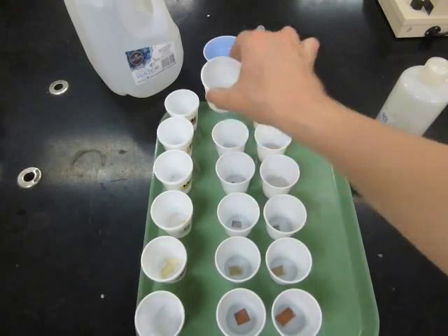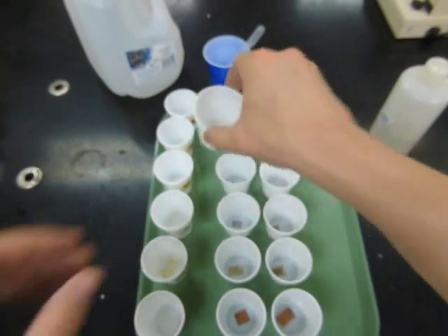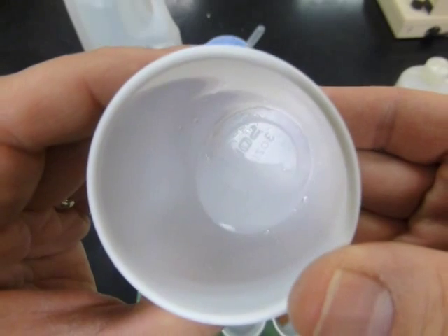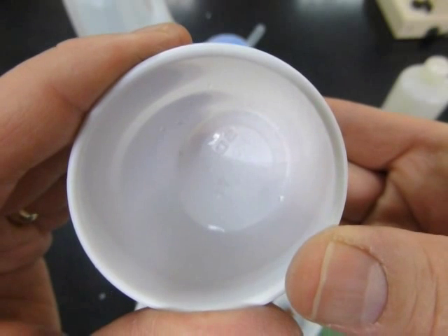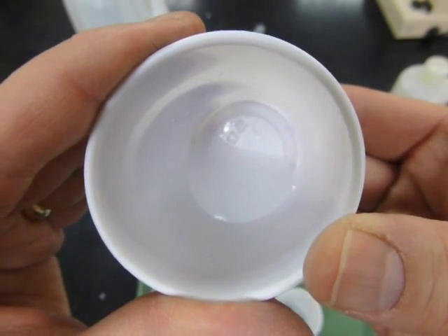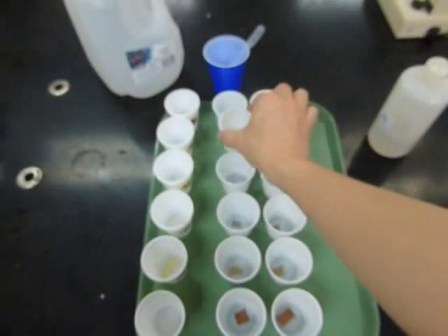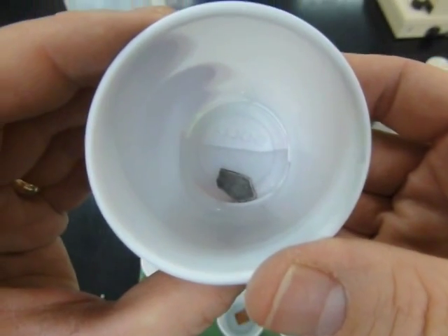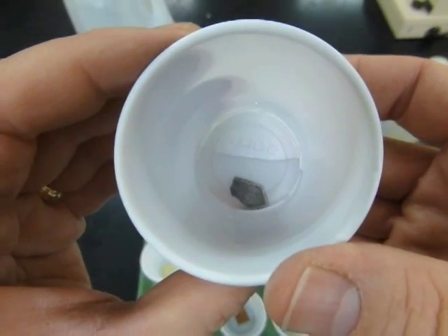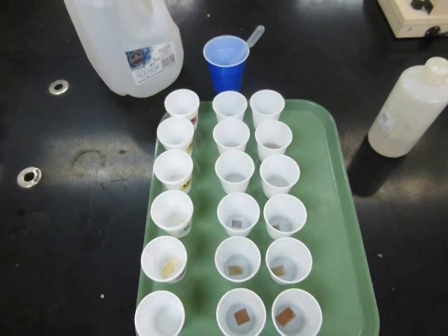Now let's take a look at the water reactions. These don't look like there's a whole lot going on, so I'm going to put them under the microscope so that you can see. That was the magnesium. Here's the calcium — the calcium is bubbling along nicely. When I put my fingers under here, I can feel that it's getting warm. It's not as hot as it was with the acid, but it's still a pretty vigorous reaction, much more reactive than the magnesium. I didn't see anything happening with magnesium. And the manganese — well, not a whole lot happening there. So I'll put these under the microscope to see what happens with the water and the magnesium and the manganese.